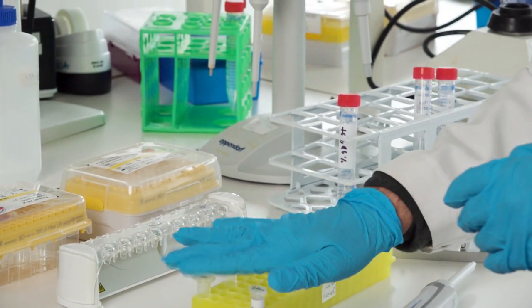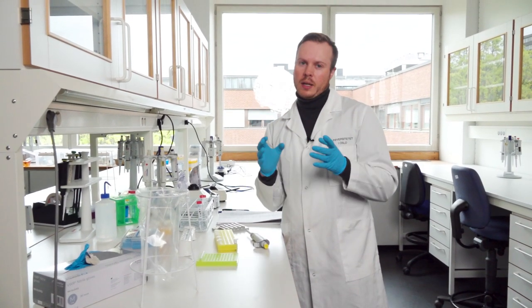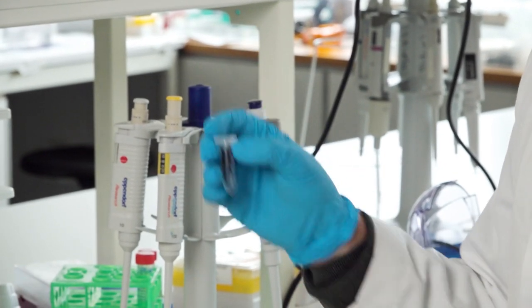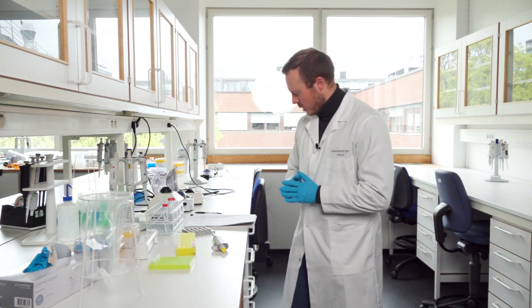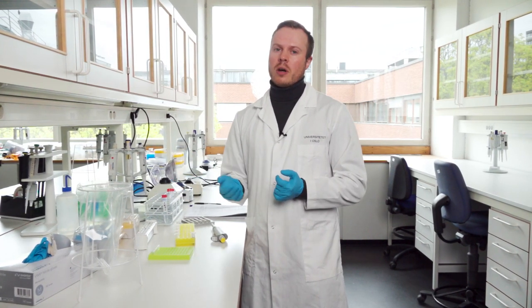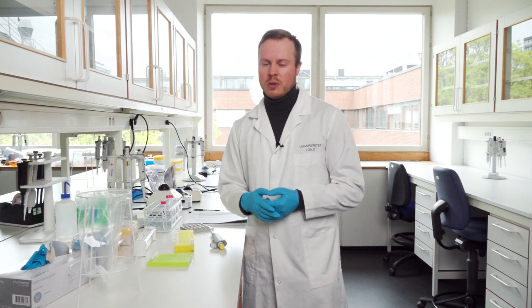After evaporating for close to five minutes, take the Eppendorf tube out and place it in the rack. Now we do the final step: getting the DNA that is bound to the beads back into solution using an elution buffer. You can use the elution buffer that comes with the extraction kit, a self-made elution buffer, or something in between. Read the protocol carefully for this step as it's where we actually recover the DNA.